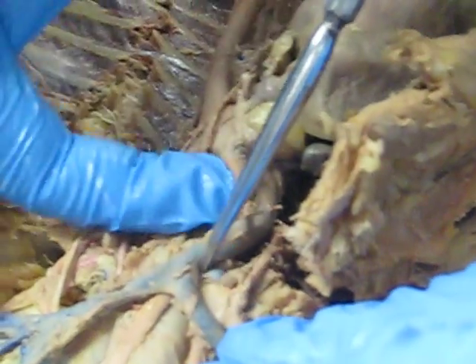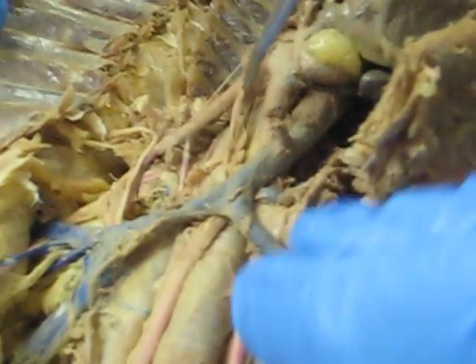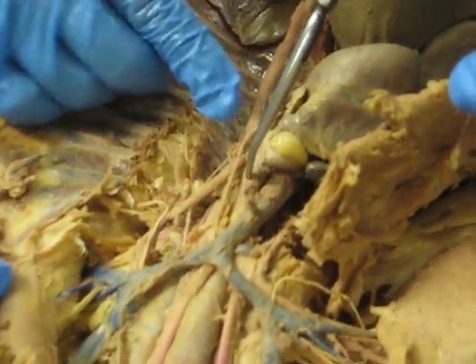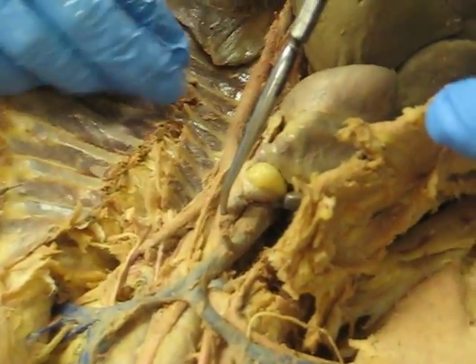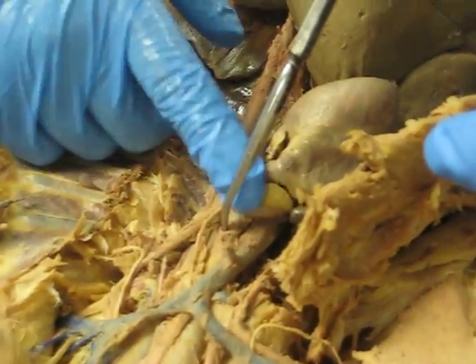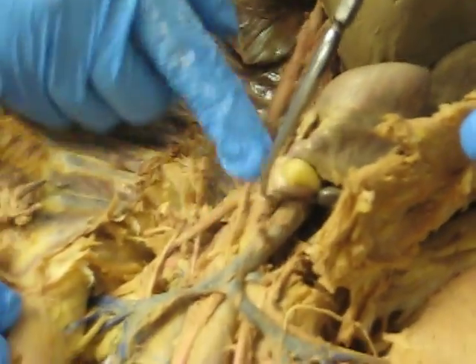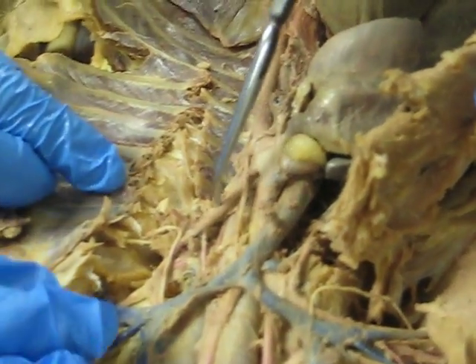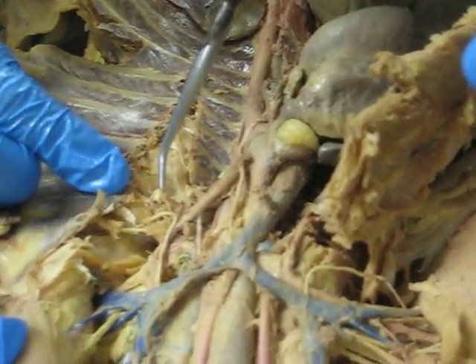The brachiocephalic is right here, and this comes into the aortic arch. Then we have the left subclavian artery branching from there as well.